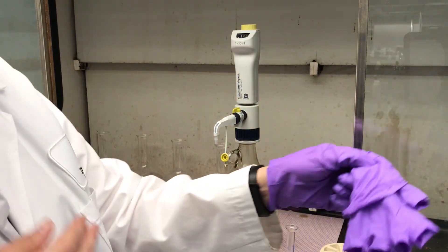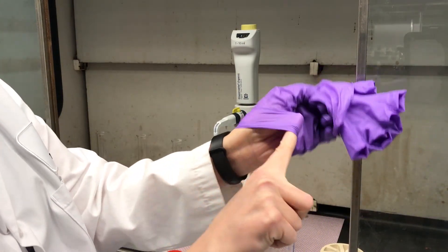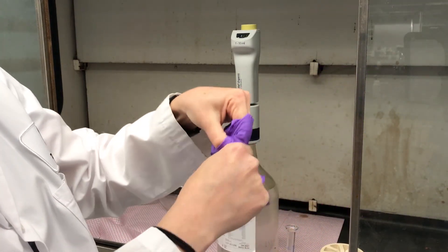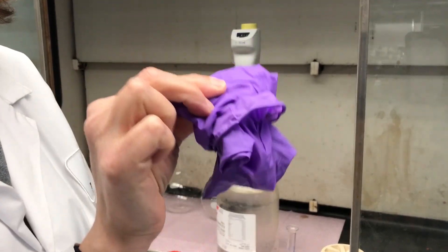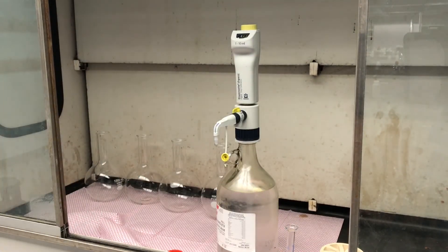And to do so, pull off one, put your finger in, and do that. Get rid of these gloves as soon as you're done with the acid. Okay, thank you.